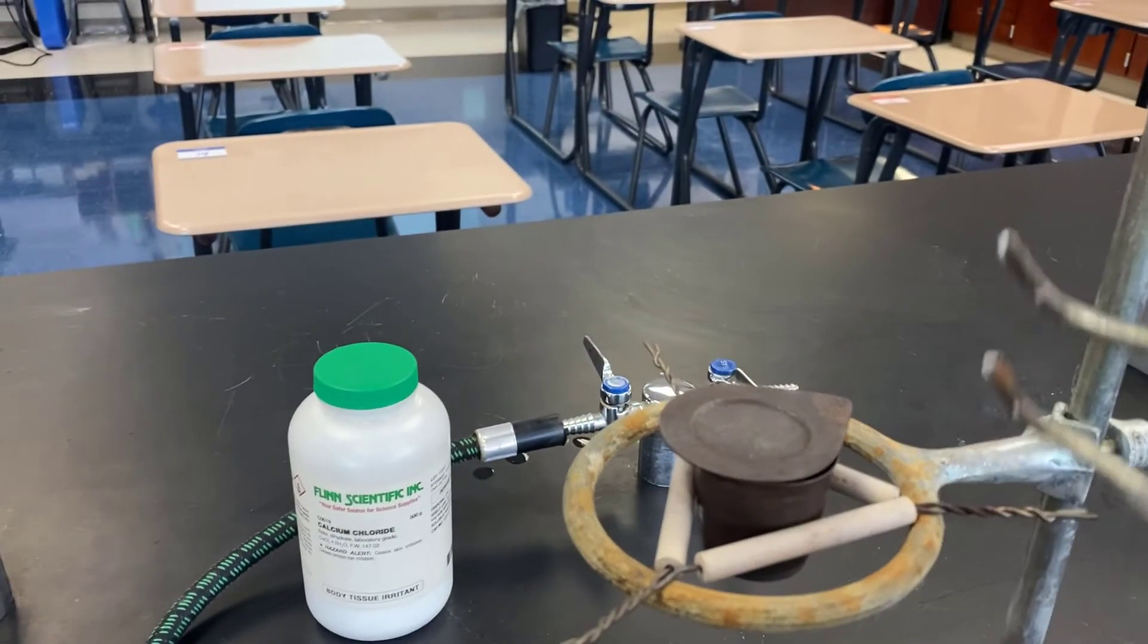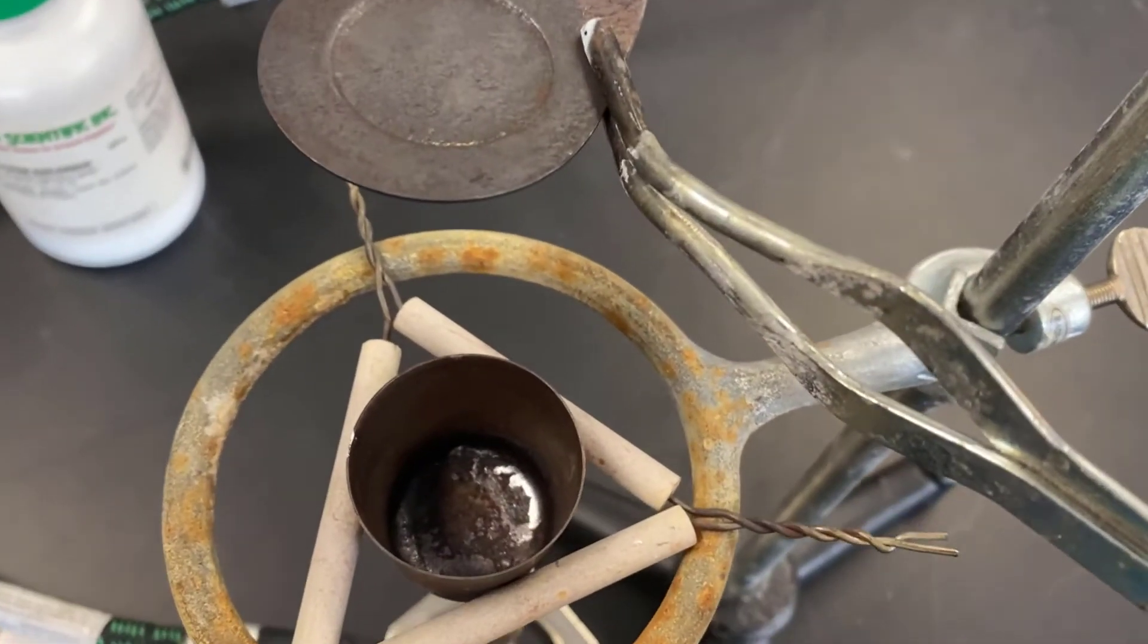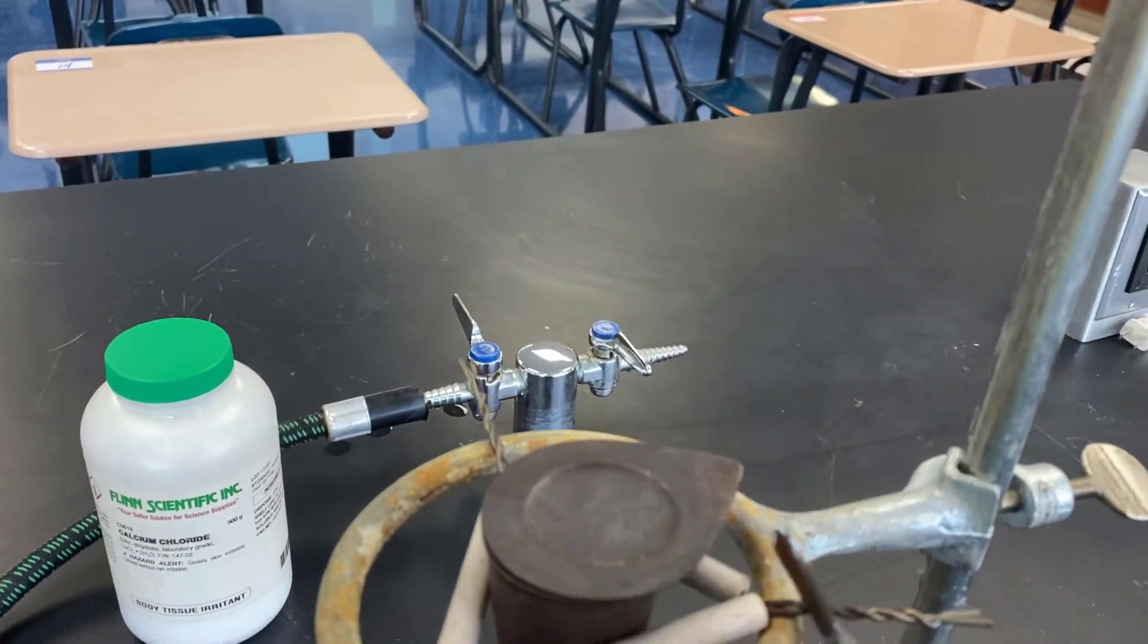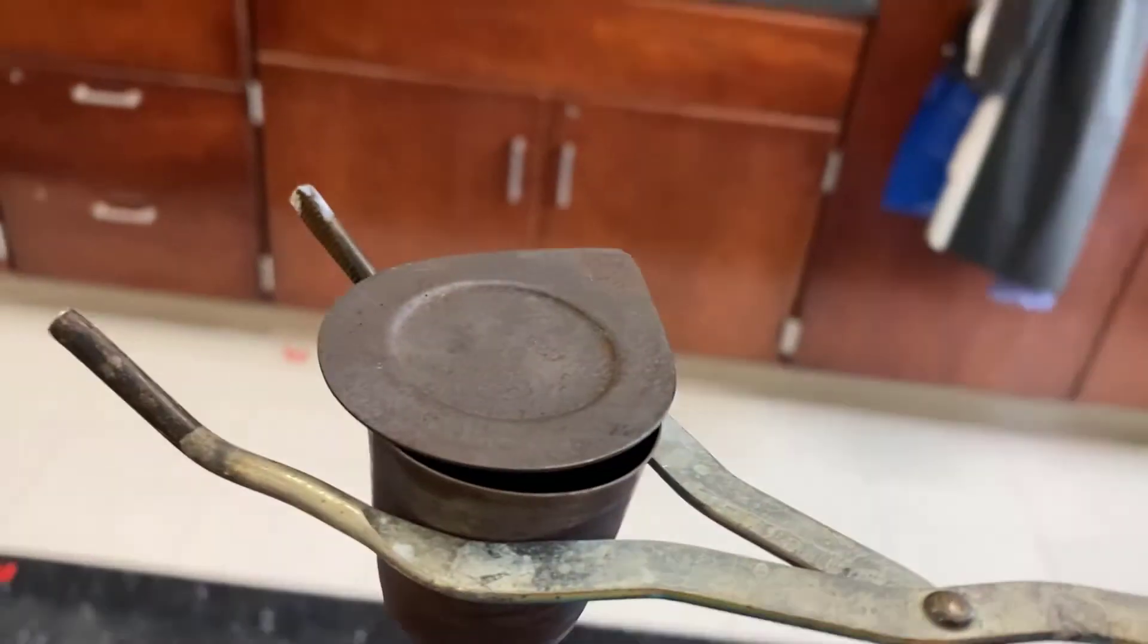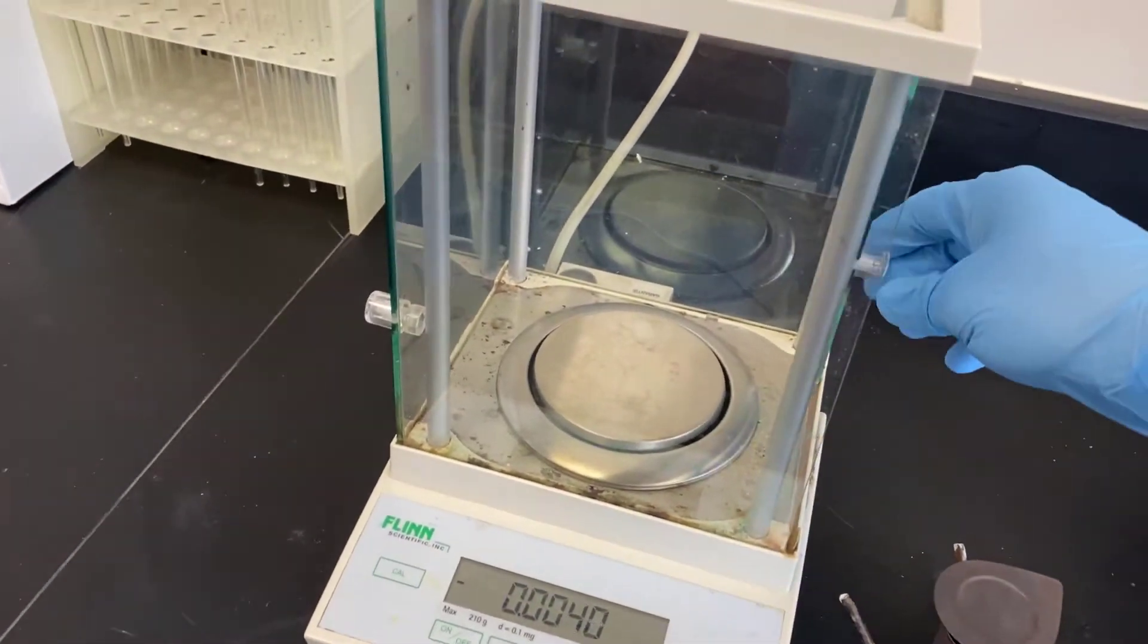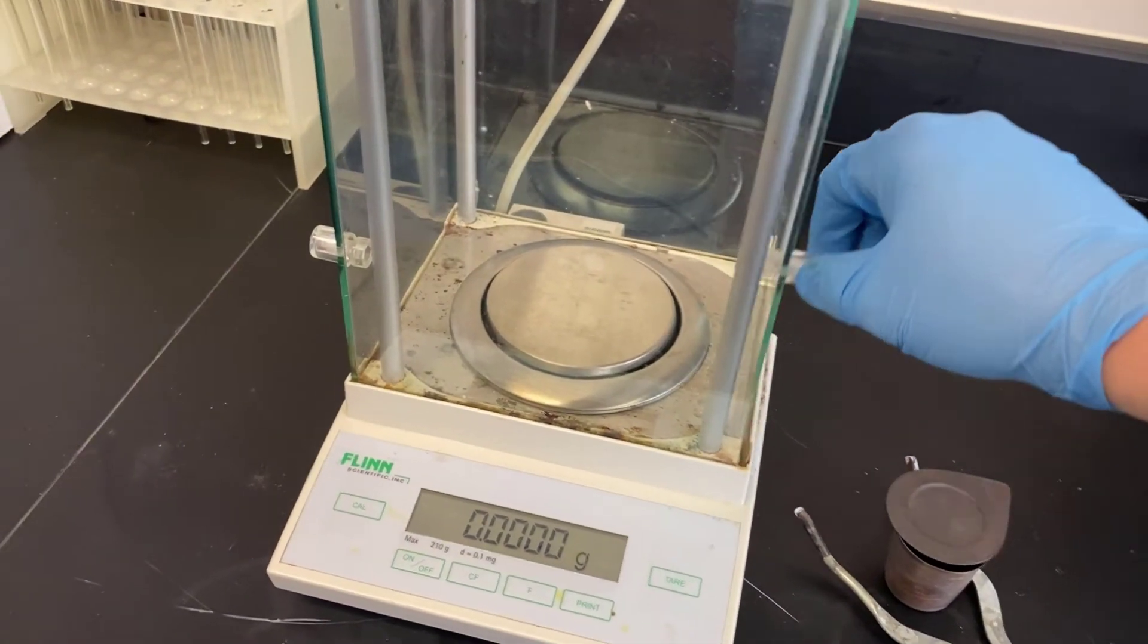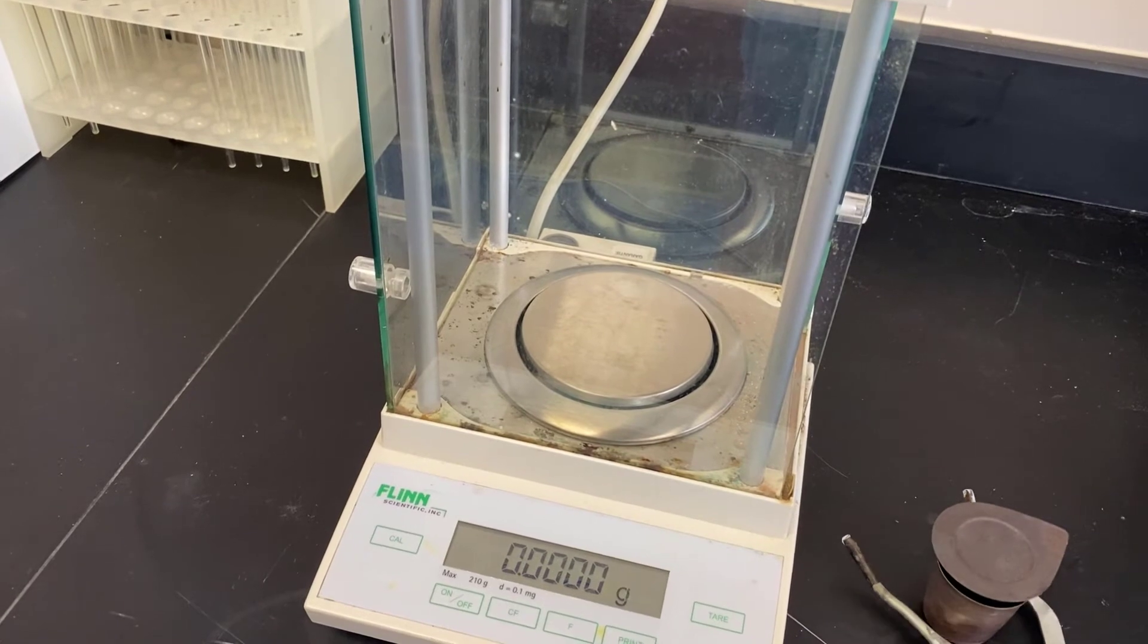Again, allow the vessel to cool, then go ahead and get its mass. Again, we heated it for about five minutes. The hope is that successive weighings will show that the mass has not changed, meaning that no more water has escaped, and all of the water that was in it has left.